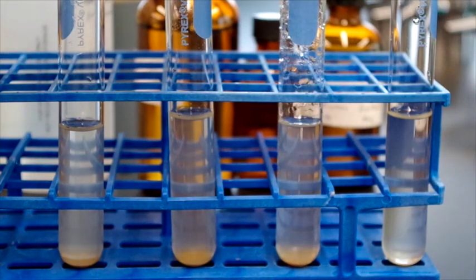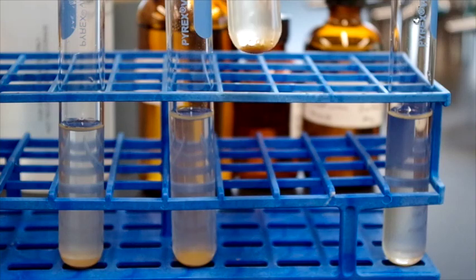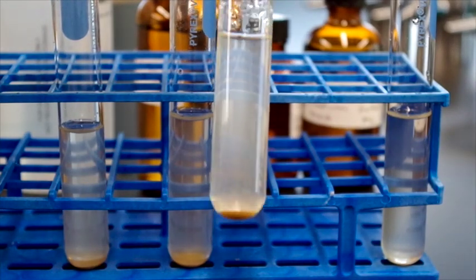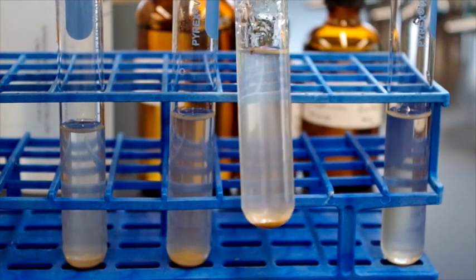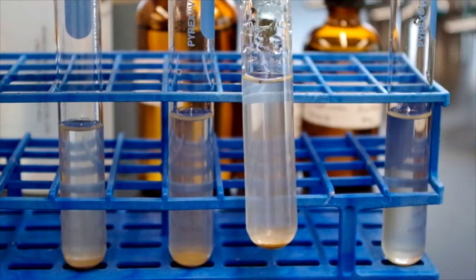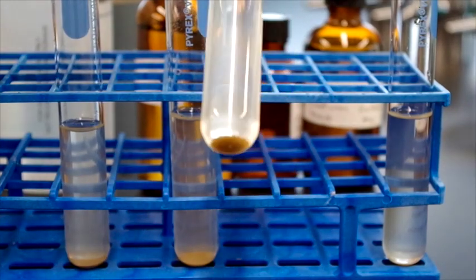The next one is the one that contains potassium aluminum sulfate. Now, this one, on the other hand, even though there's still some discoloration and some things floating around in the water, the actual mud has been reduced. And this has to do with the various solubility of the potassium aluminum sulfate and its ability to take insoluble salts and put them into solution, thus reducing the total amount of particulate matter.